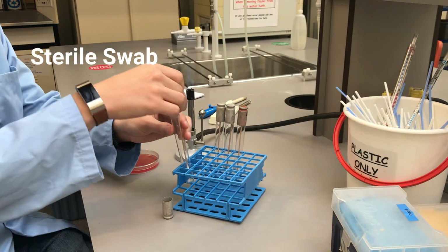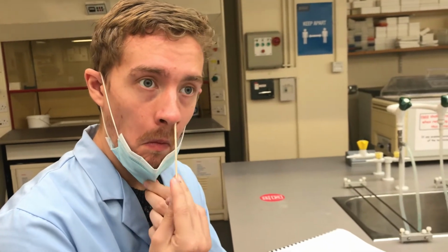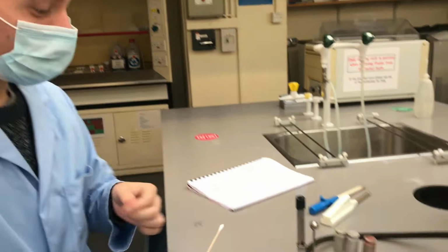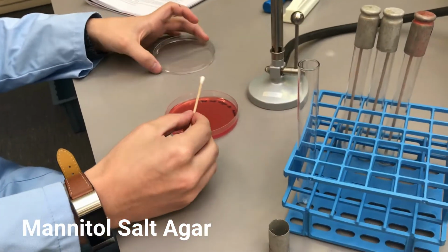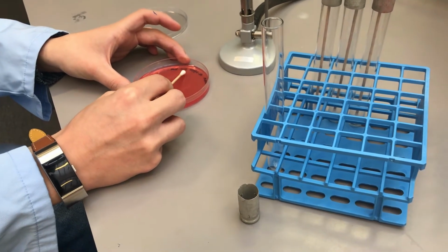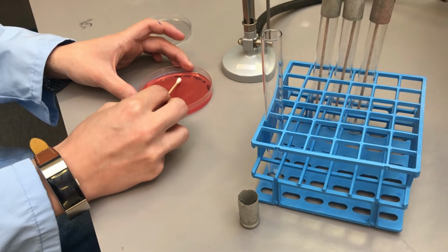To begin, take a sterile swab and roll around the inside of the nasal passage. Remember to make sure the environment is sterile using a Bunsen burner. Roll the swab across a small area of mannitol salt agar. The number of recovered organisms may be low, so remember to roll the entire swab over the agar.